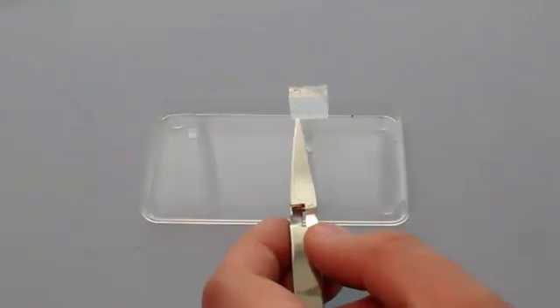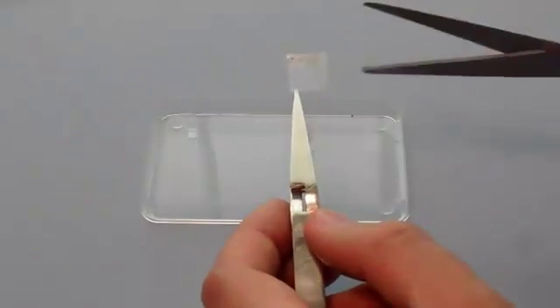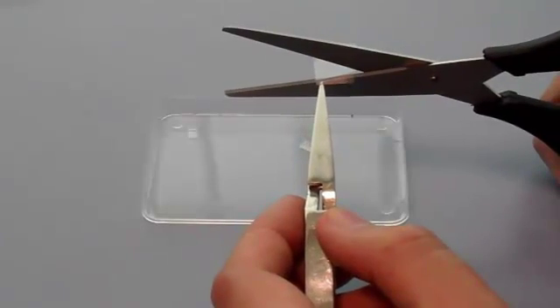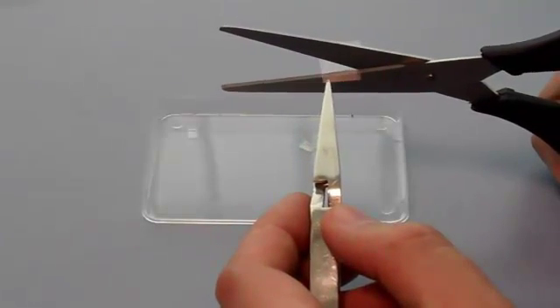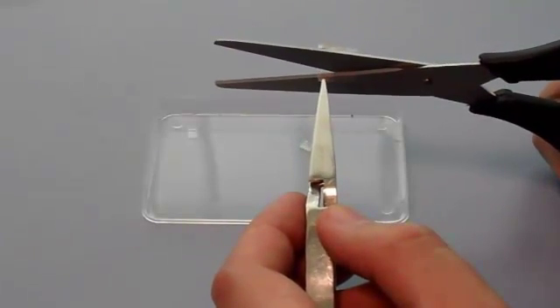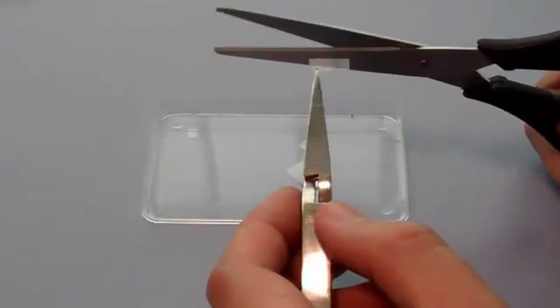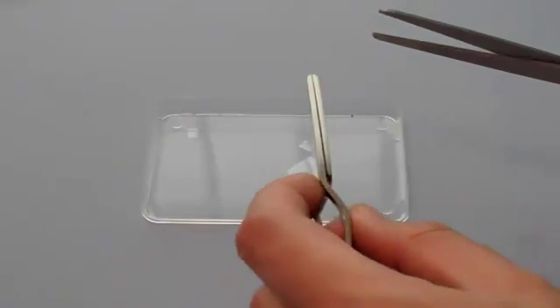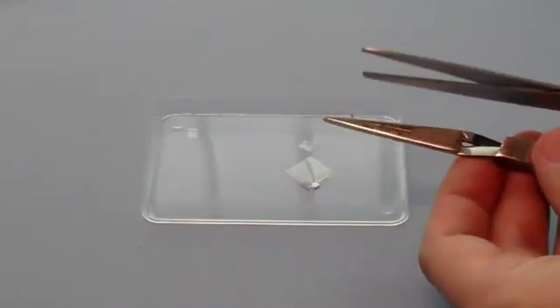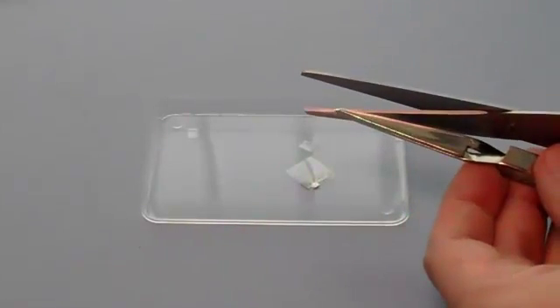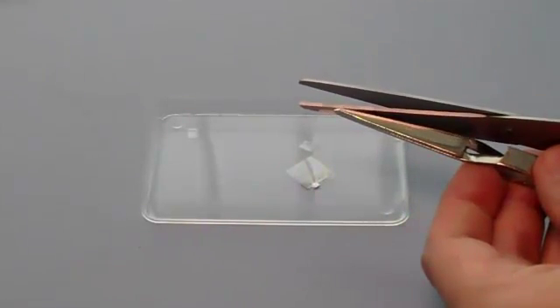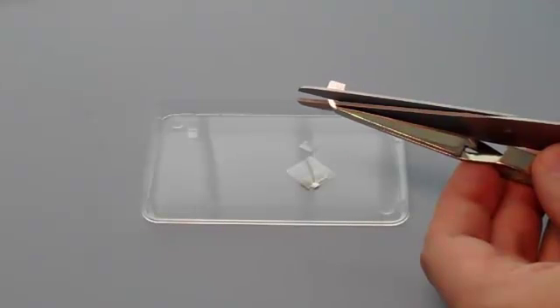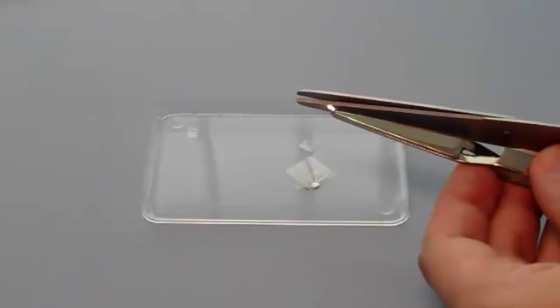Once the holder is in place on the gluing tool, the sample itself is prepared. Samples can be polymer films, as in this video, or can also be glass or some other thin coating. Attaching an individual sample to the holder will be specific to each sample.